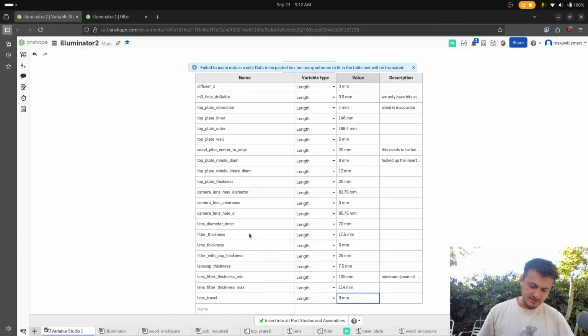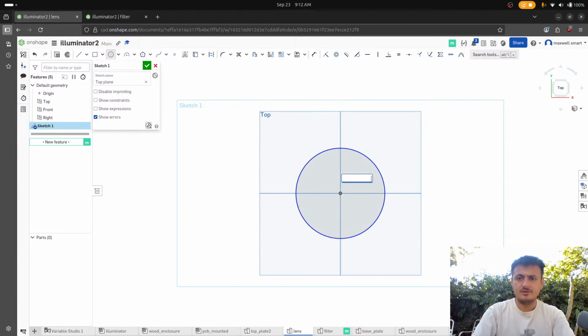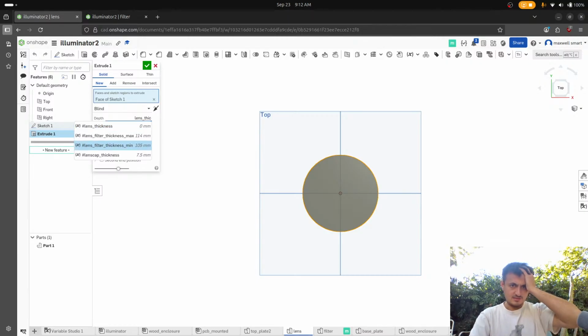Okay, so now the lens itself. Well, I guess we could. Okay, well let's try it with this. So this is the lens. So we're going to, and we're just going to do a cylinder. And this is going to be lens diameter. And we're going to extrude this lens thickness. So we want the min.